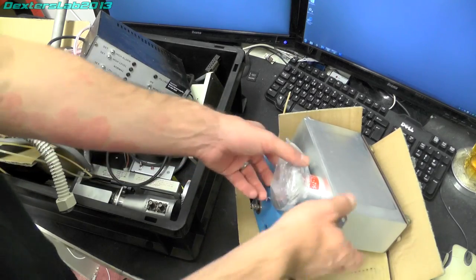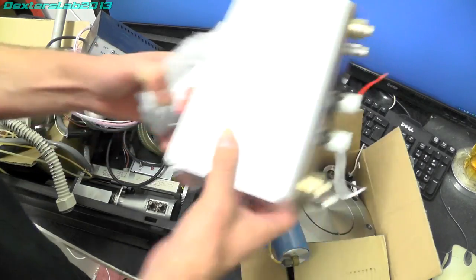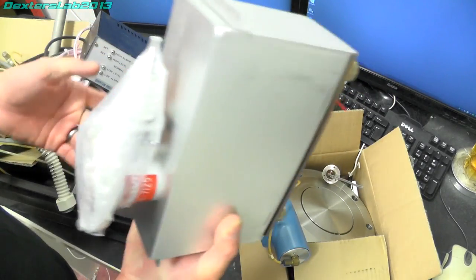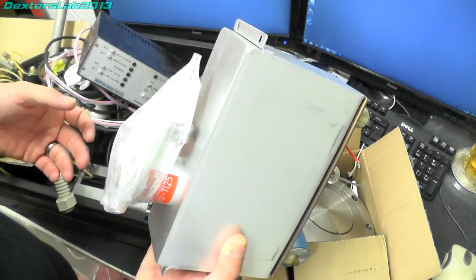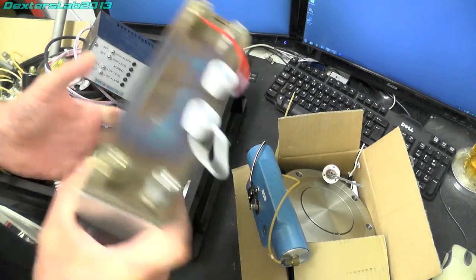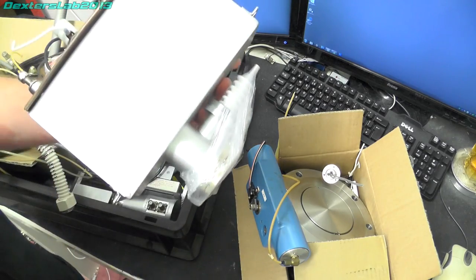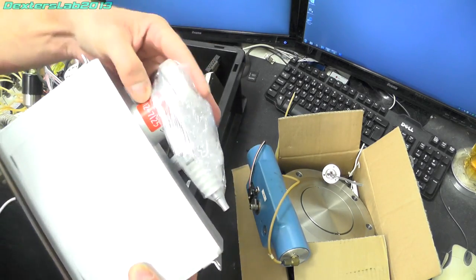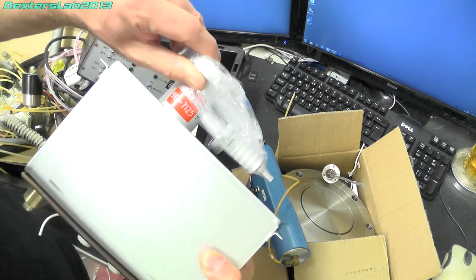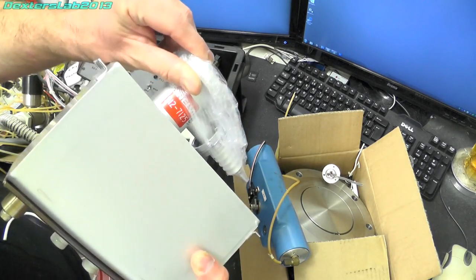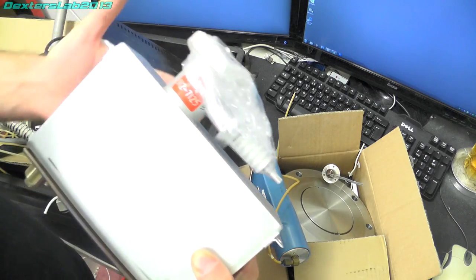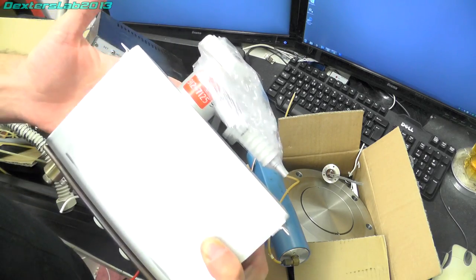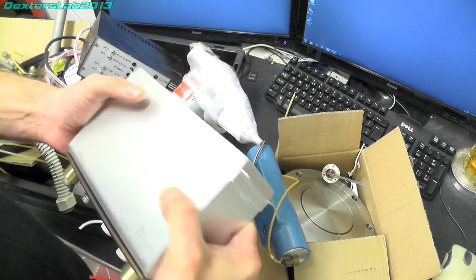Right so let's start at the big box here. This is one of the ion pumps, this is one of the smaller ones. It's manufactured by Anelva which is a Japanese make, part number 9127125.